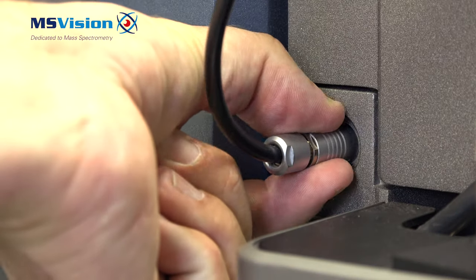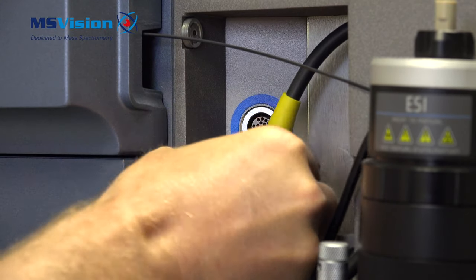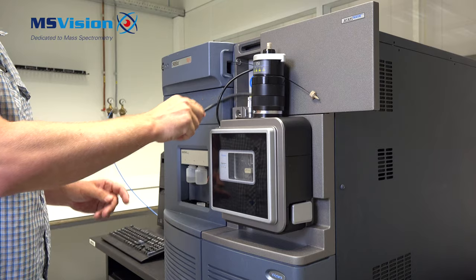Pull the collar at the rear so we can remove it and the same for the larger one which is a tight fit. Let the cables hang downwards.